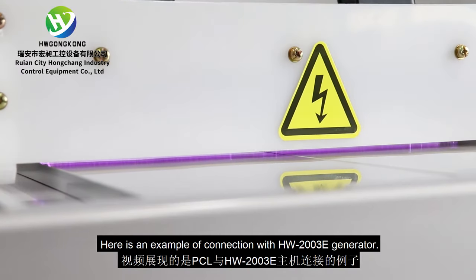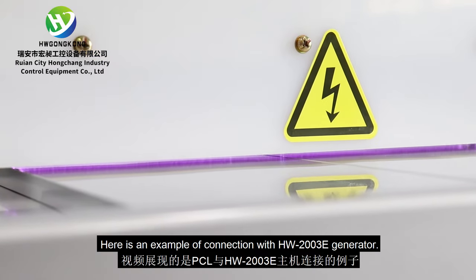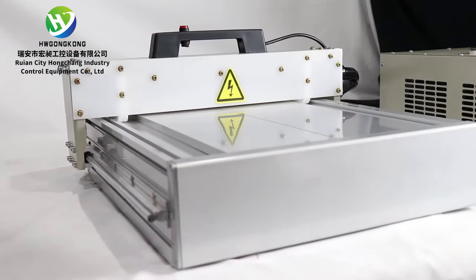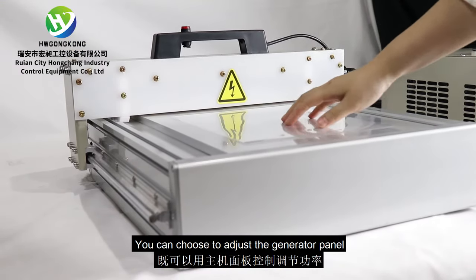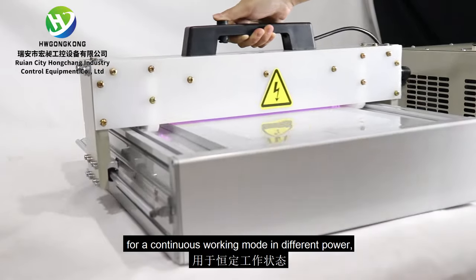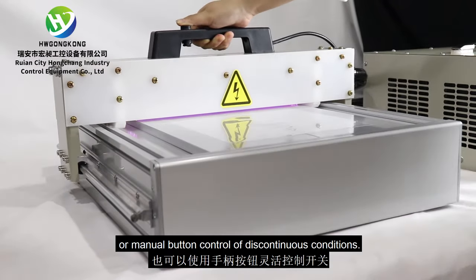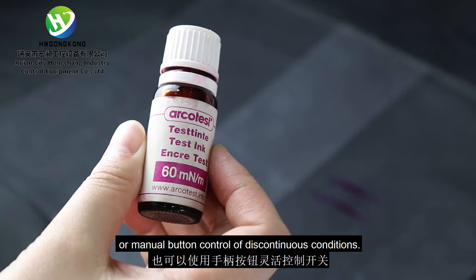Here is an example of connection with HW2003 generator. You can choose to adjust the generator panel for a continuous working mode in different power or manual button control of discontinuous conditions.